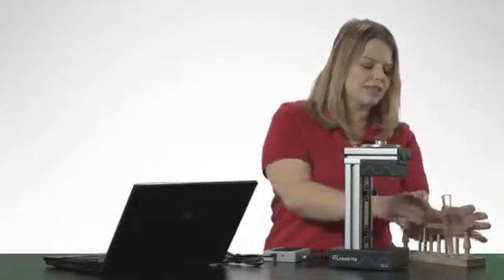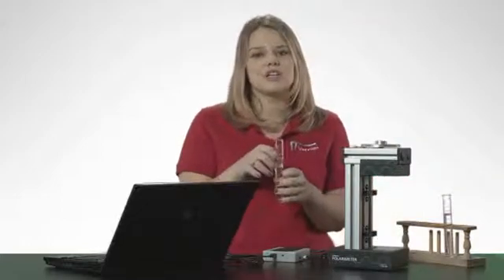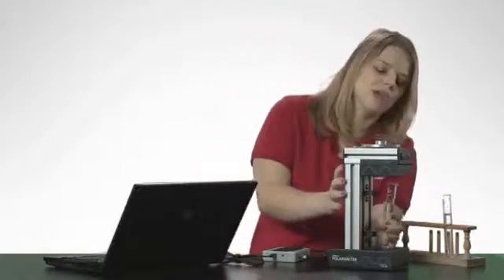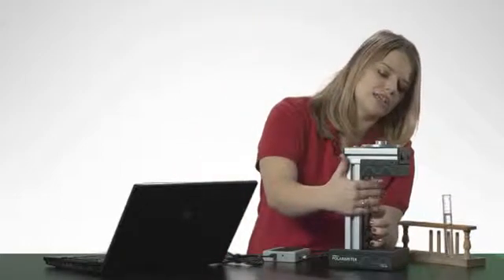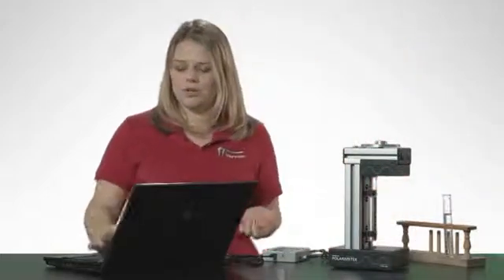Now I'm ready for my optically active sample which is a 30 percent sucrose solution. I've also filled this one to 10 centimeters. Place it in the polarimeter.